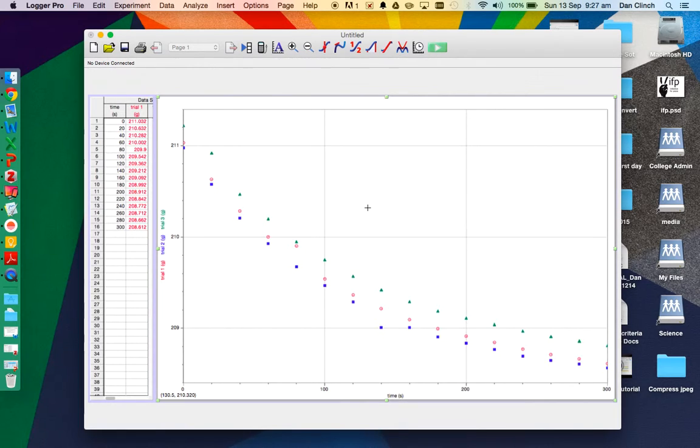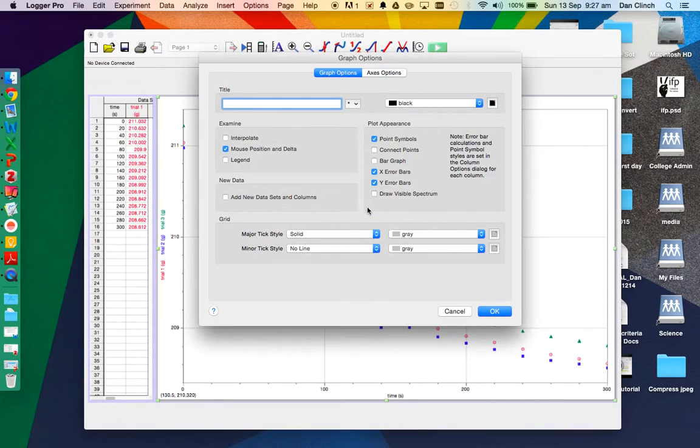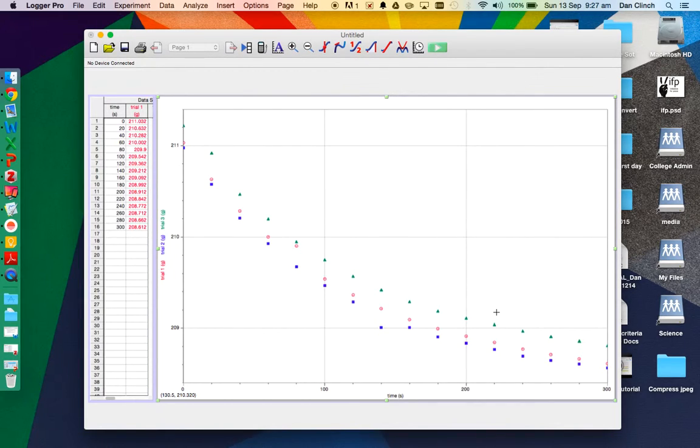If, and this might be the case if you're using data logging, it's automatically connecting the dots, just check that this box is not ticked, so that it doesn't connect the dots, it doesn't do a dot-to-dot graph. But that's my data plotted.